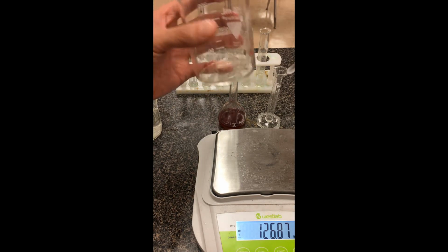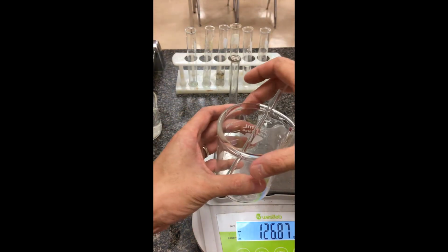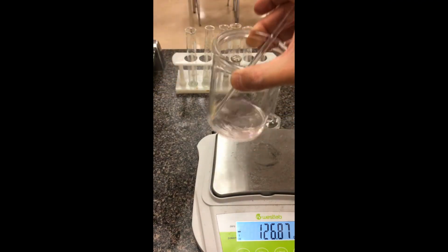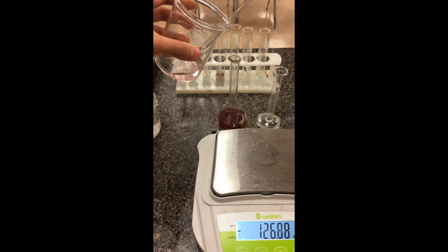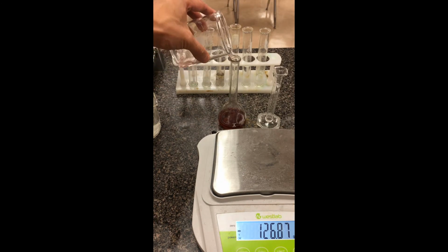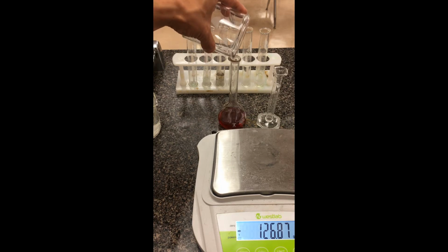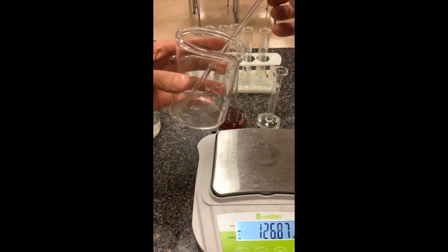So that's fairly good. I don't see traces of solid left over, but there may still be a little bit of reddish solution of cobalt nitrate. So I'm just going to add a little bit of water. Just try to rinse down the sides, rinse down the glass stir rod as well. And again, I'm just going to add these rinsings here. We want to make sure all the powder we have used all gets in the volumetric. This beaker now looks very clear, so that's good.